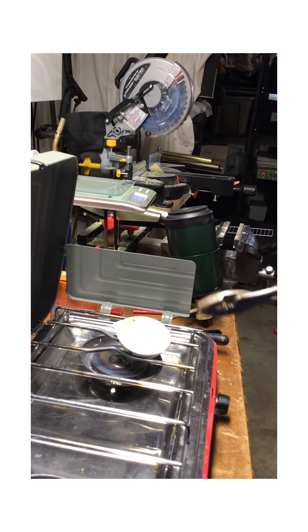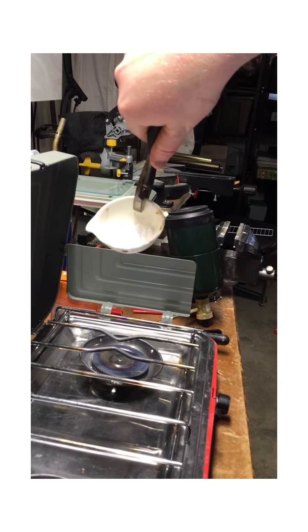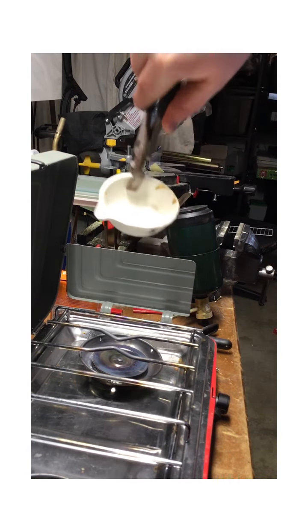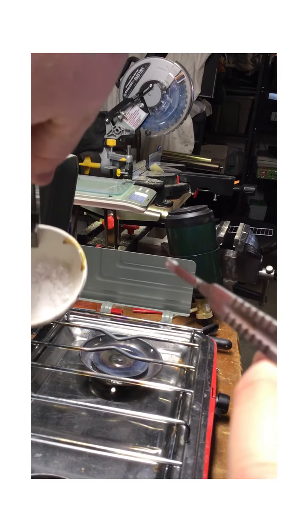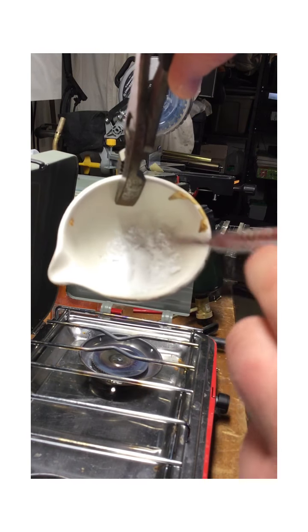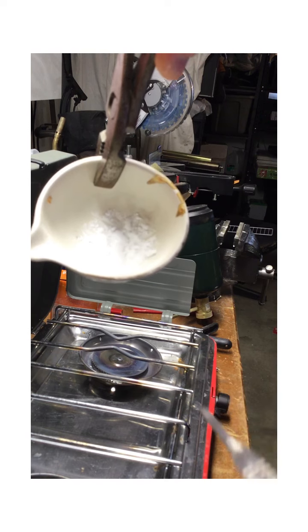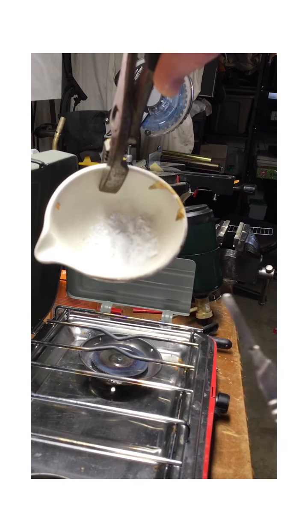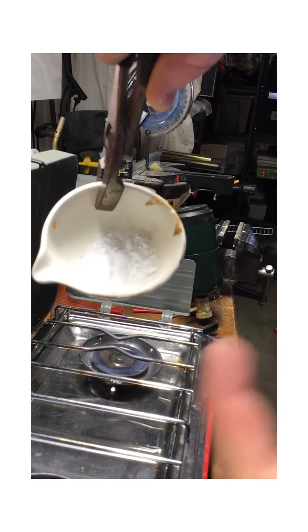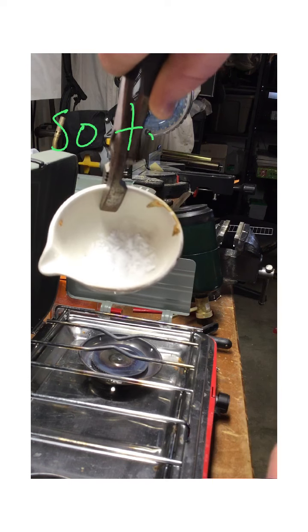All right, so you're back, and for the last 5 to 10 minutes, we've been heating this, and there was no color change, so it doesn't really look that different. And I don't want to poke it because then I might remove some of it. But hopefully you can see it's kind of hardened up. It's no longer a powder. And I'm not going to tell you the observations of what happened during it because that might give away what happened, but I've now let it cool enough that I can safely put it on my scale.